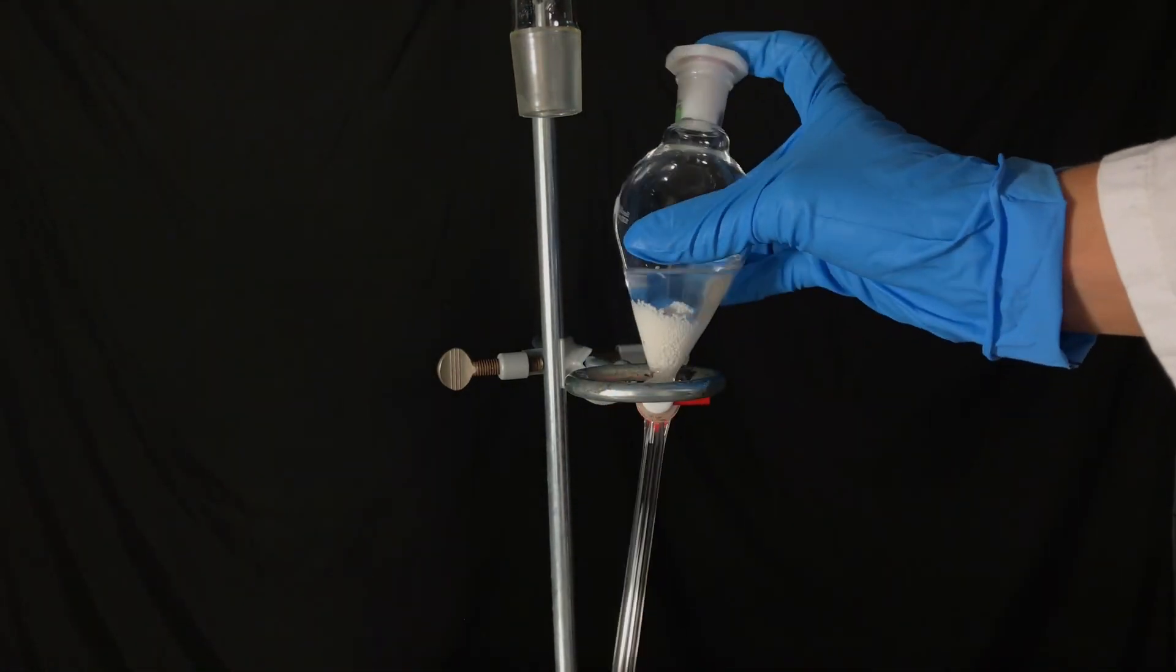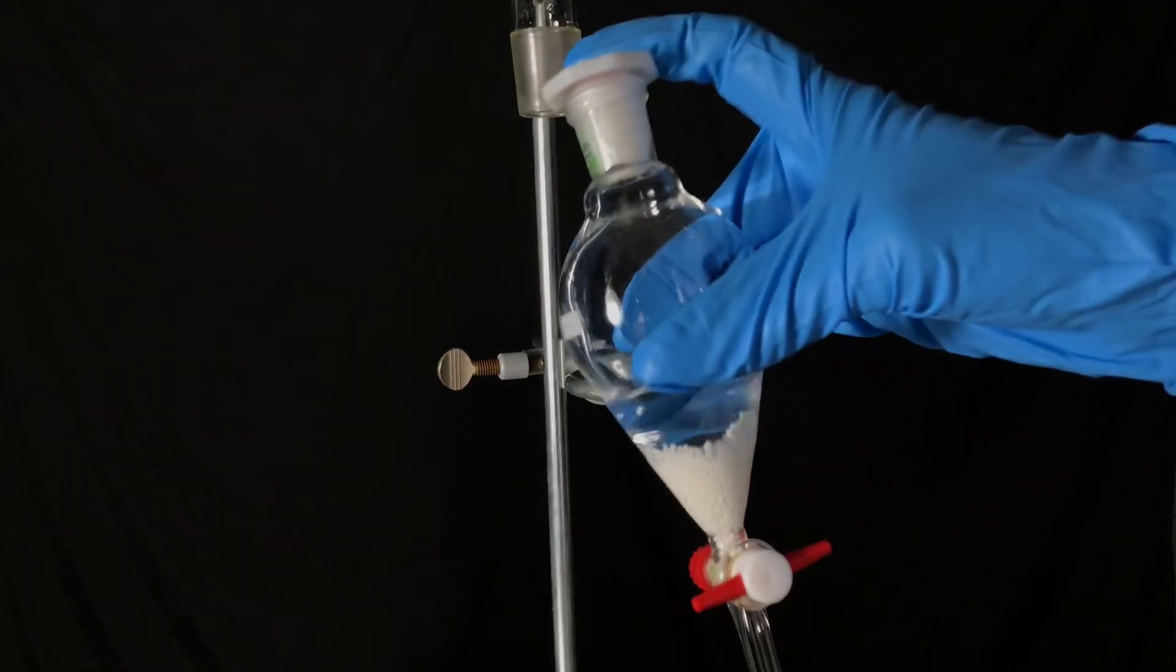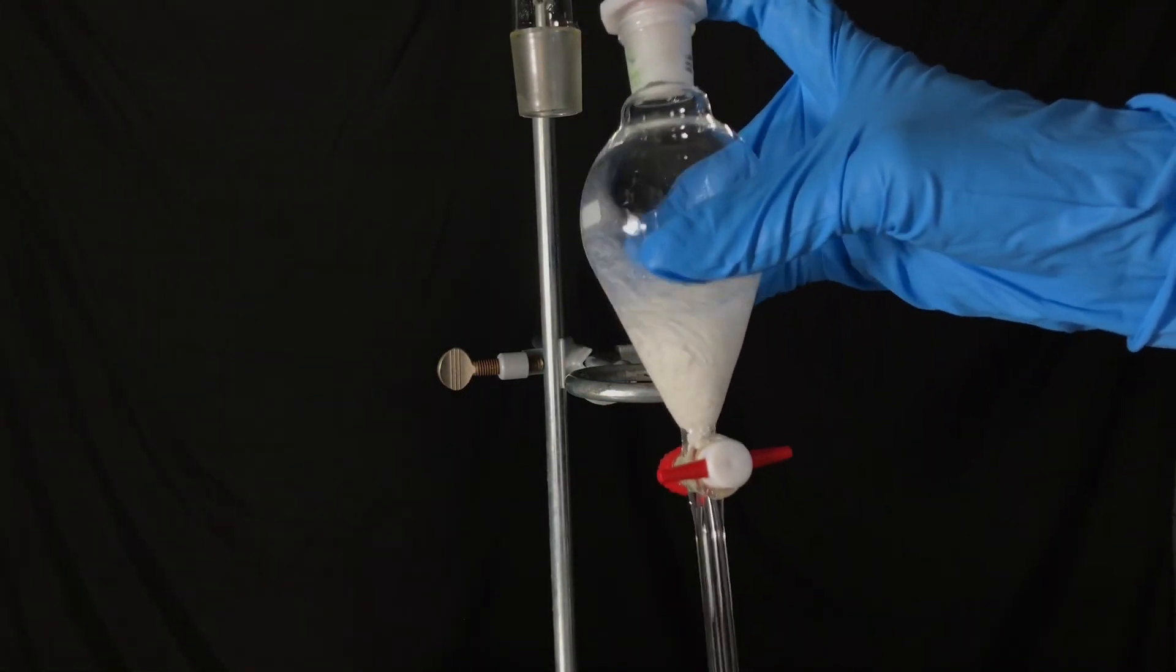The separation funnel was taken out of the holder, shaken, and left to stand for 20 minutes.